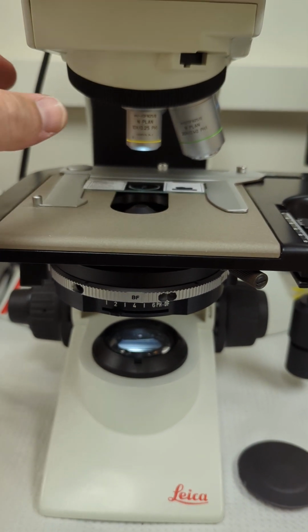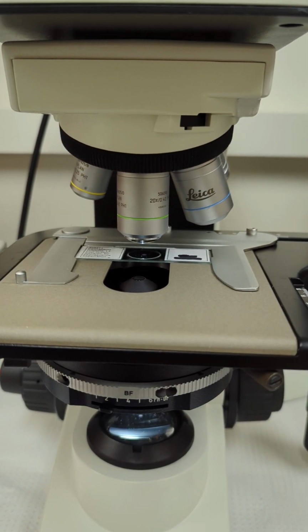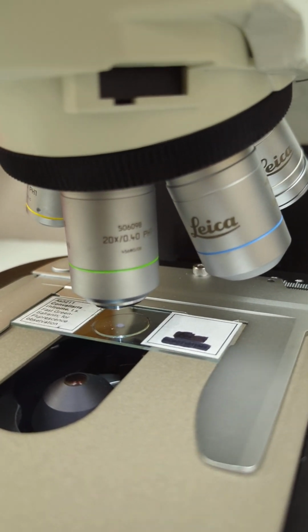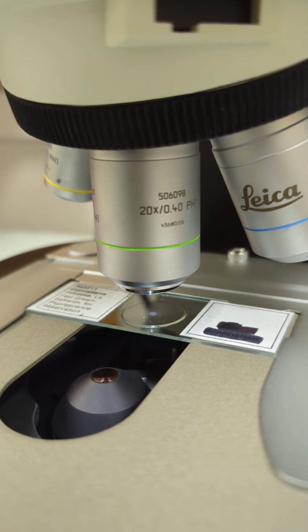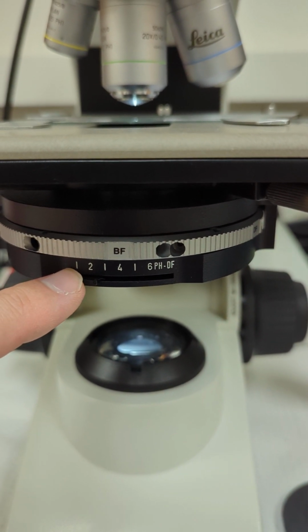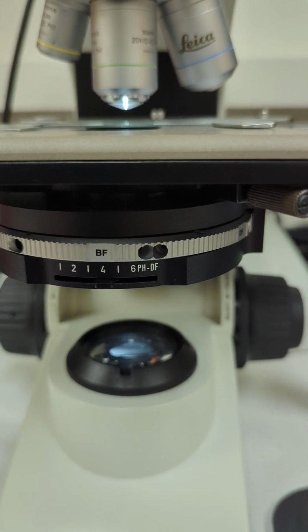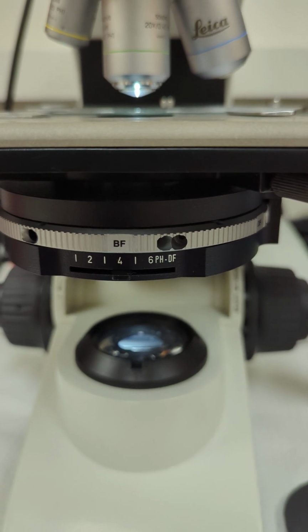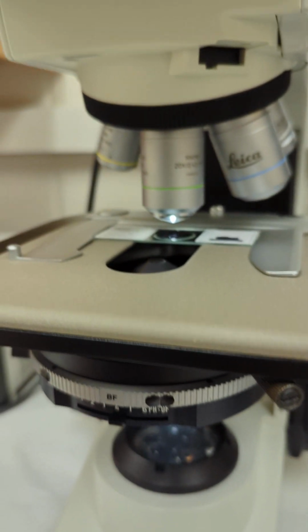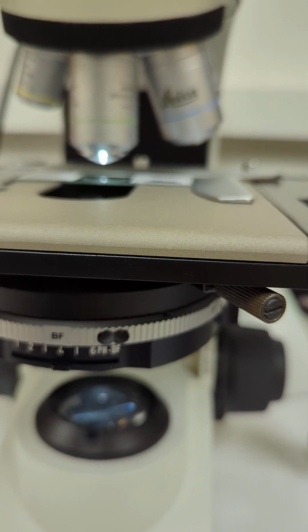Once you switch objectives, then, let's go to the 20x. And the 20x is a 0.4 NA. You can see that, 20x 0.4. So down on the condenser, you want to remember to move it up to 40, or the 4. So that's how that relates. So just imagine the 0.4 is like a 40 or 4, whatever.